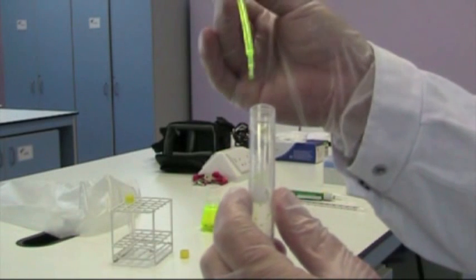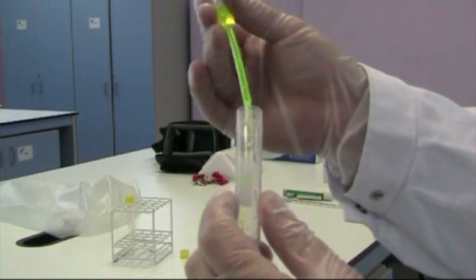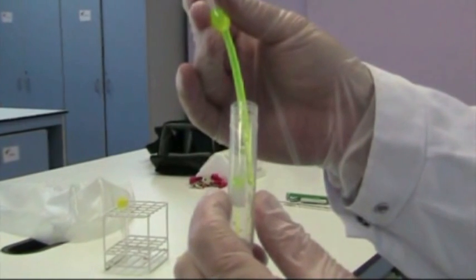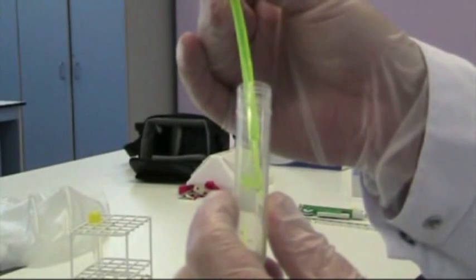So to improve accuracy we can use the surface tension of the liquid and to do this we take the tip of the pipette and we place it on the edge of the vessel and gently squeeze the tube. And you can see the droplets here are dragging down using the surface tension of the liquid.